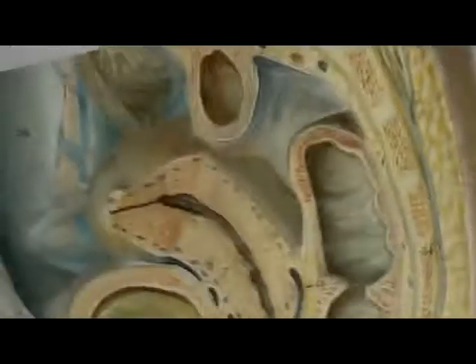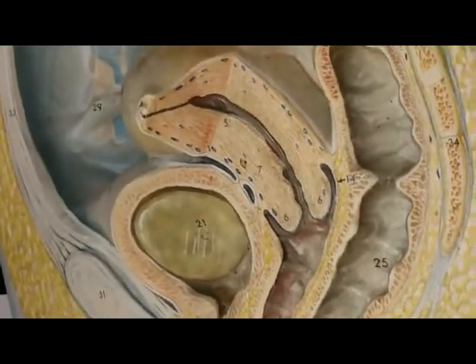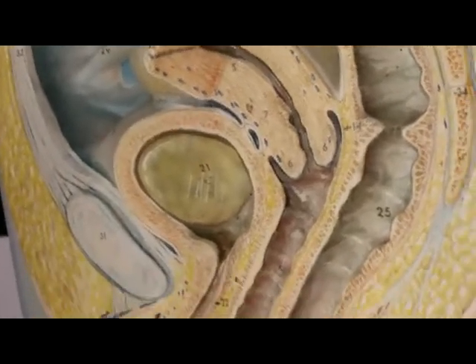So the adrenal gland, is it on your list? No, it's not on your list, so we leave it on. Suprarenal gland, the very top. Oh yes, it's there. Suprarenal glands or the adrenal glands. Okay, let's go back to the female.